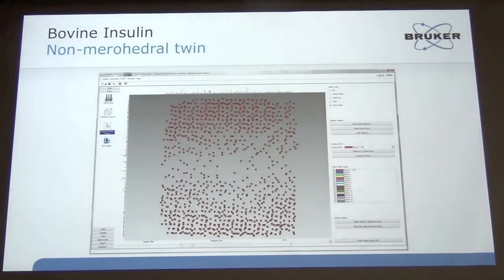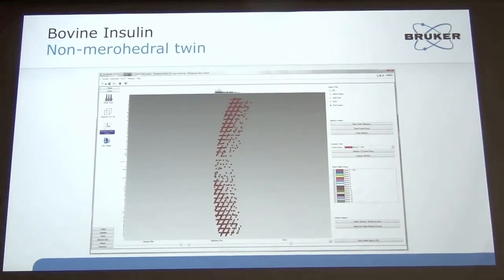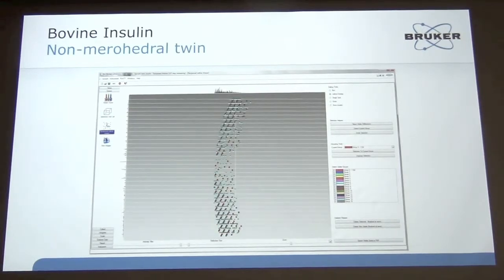So if you look at it in RLATT, it really pops out that there's just a strange distribution of spots in the reciprocal space. As I rotate it 90 degrees, then it's really easy to see the two overlapping lattices in there.